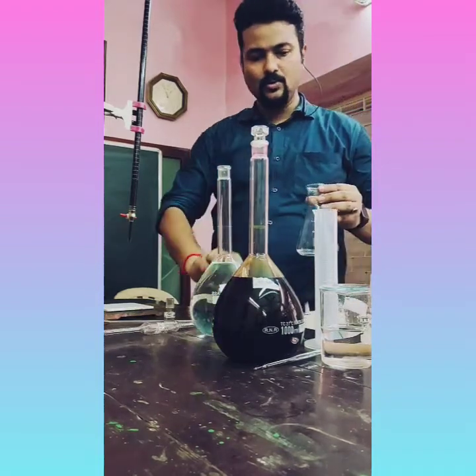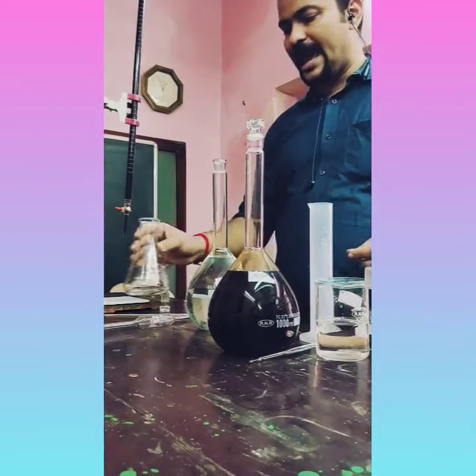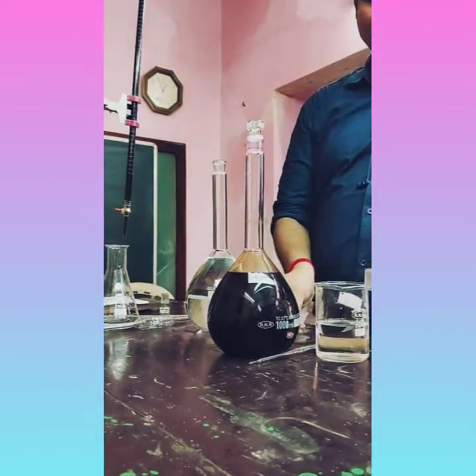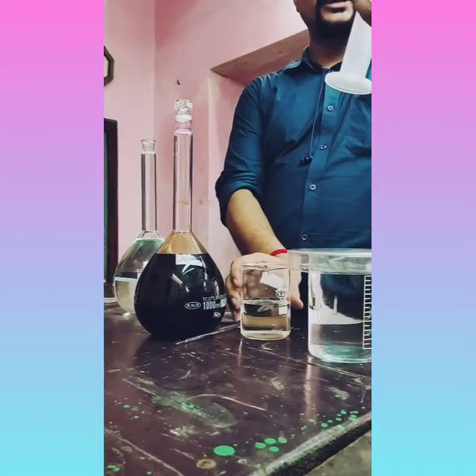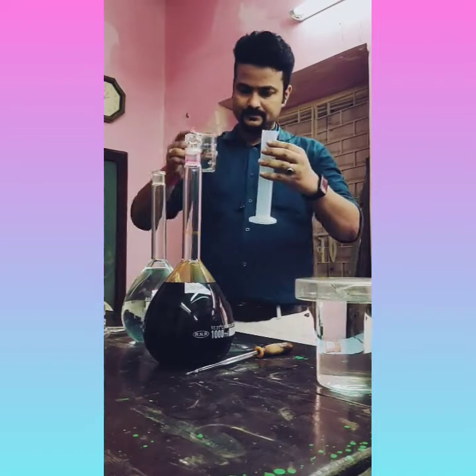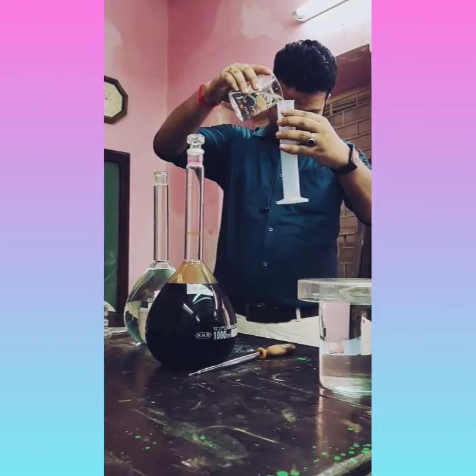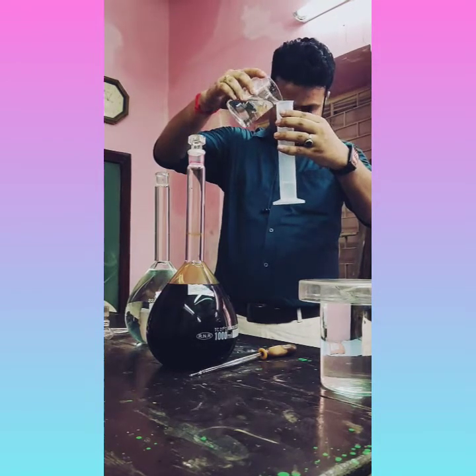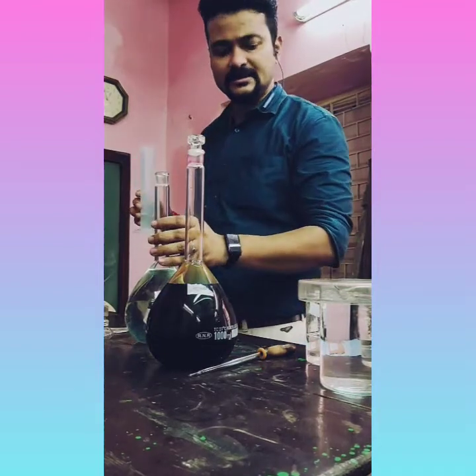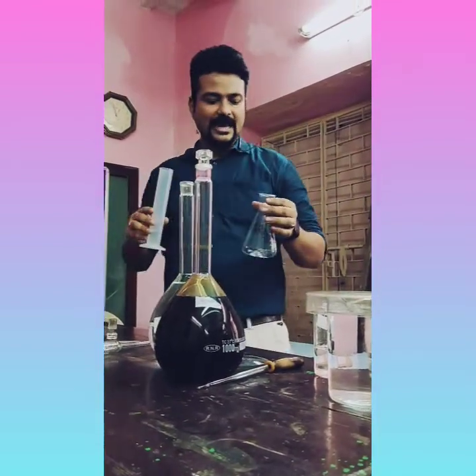Now with this 25 ml Mohr's salt solution, we have to add acid solution here. This is sulfuric acid solution. We have to take almost 20 ml of sulfuric acid solution, students. 20 ml at least. Sulfuric acid we are using because this reaction prefers acidic medium. That's why we are using acid, H plus, here.